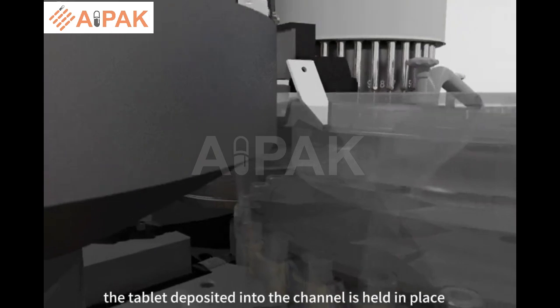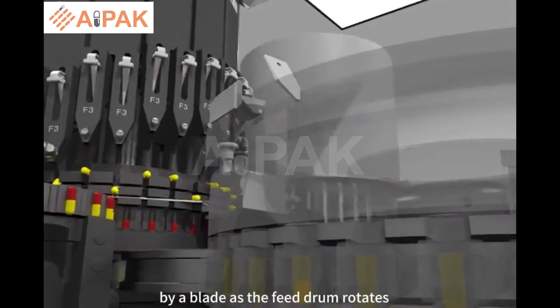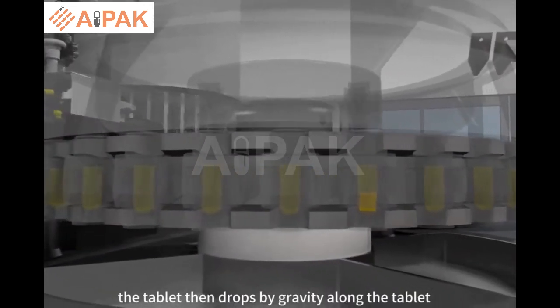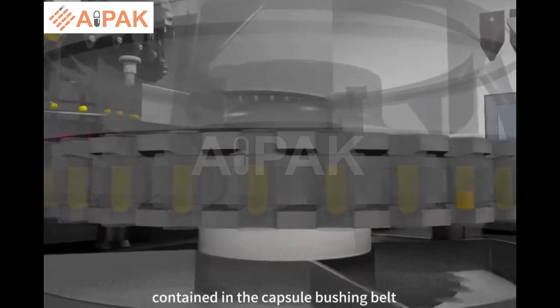The tablet deposited into the channel is held in place by a blade as the feed drum rotates. The tablet then drops by gravity along the tablet chute and into the capsule body contained in the capsule bushing belt.